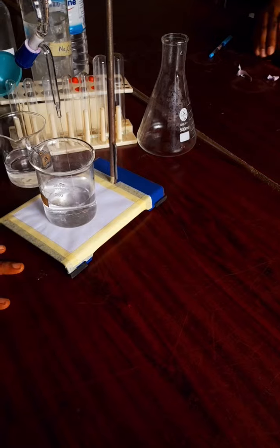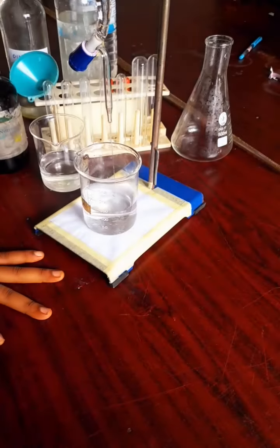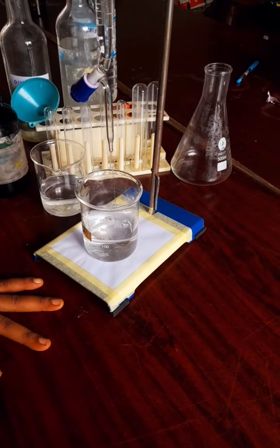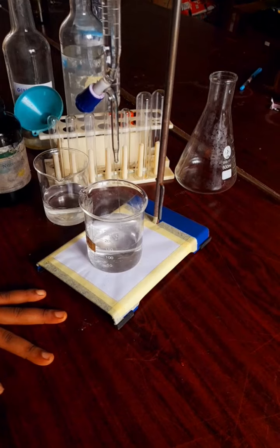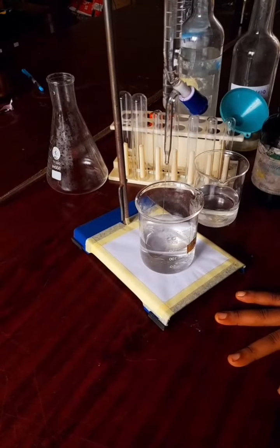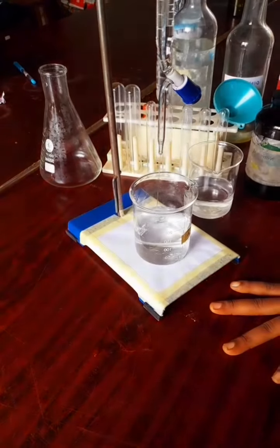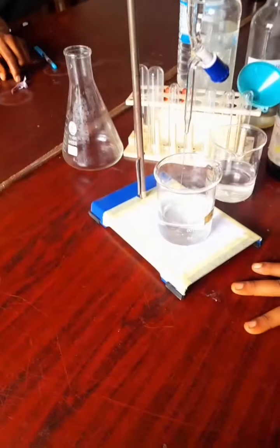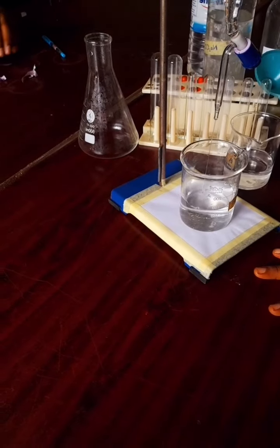What we're going to do in the calculations is to find the concentration of B in mole dm cube, find the concentration of A in mole dm cube, find the concentration of A in gram dm cube, find the volume of gas evolved in the reaction at STP, and possibly we calculate the number of hydroxonium ions that could be present in the solution. So the first part is to carry out the experiment and calculate the average titer. So let's go.